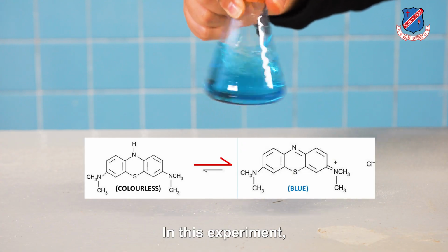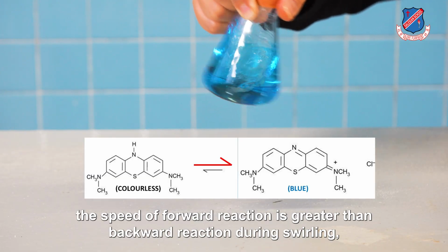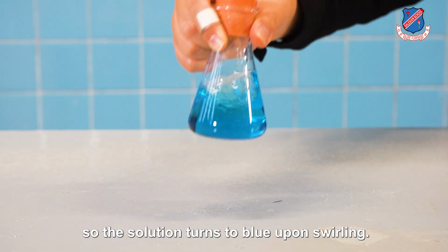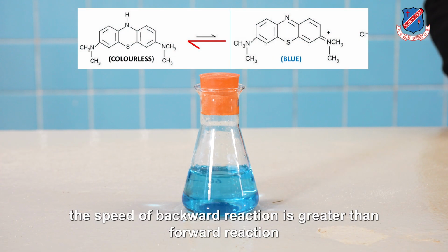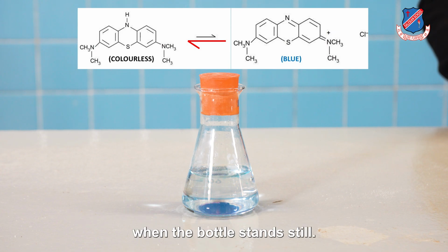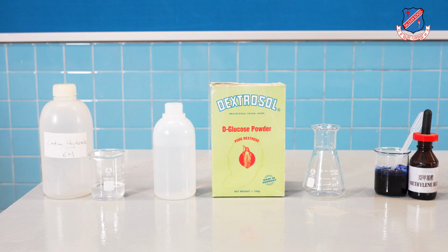In this experiment, the speed of the forward reaction is greater than the backward reaction during swirling, so the solution turns to blue upon swirling. However, the speed of the backward reaction is greater than the forward reaction when the bottle stands still. And that's why the solution turns colorless when the bottle stands still.